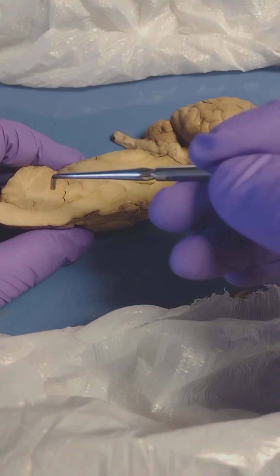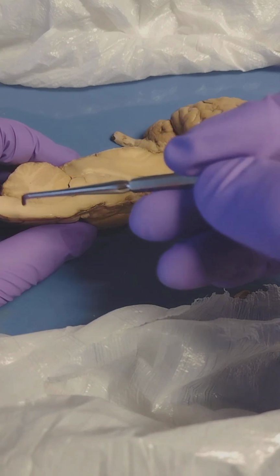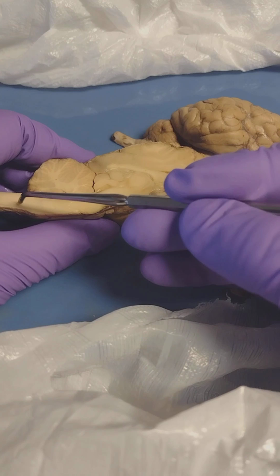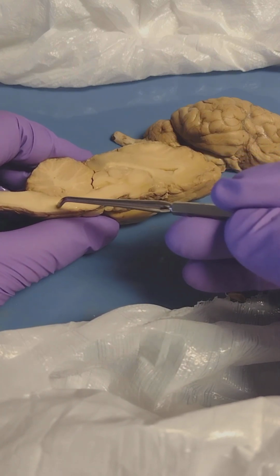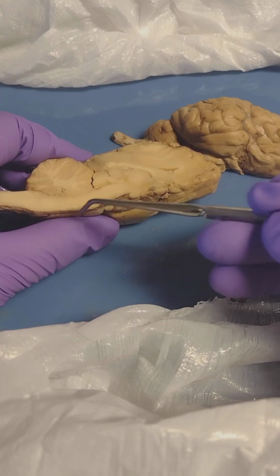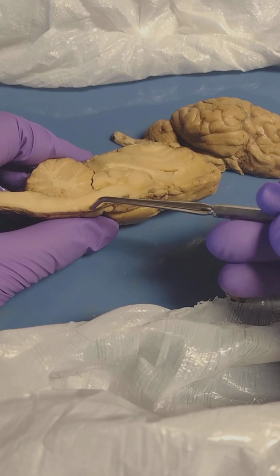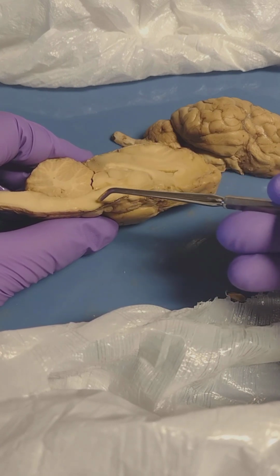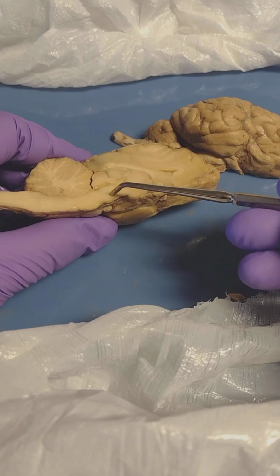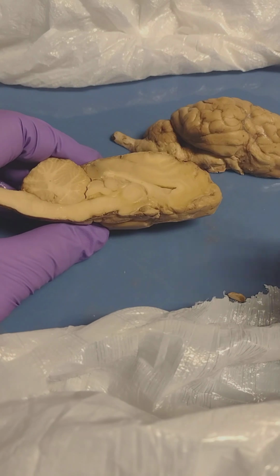So let's talk about the brainstem for a second. Like I mentioned earlier, this entire region will be the brainstem. Down here, of course, you have the spinal cord. As you move up, you have the medulla. The medulla helps regulate heart rate, blood pressure, and breathing. And this little bump right here, that is the pons. It transmits sensory and motor signals, and it helps in REM sleep and plays a role in regulating breathing. Up here we have the midbrain, which coordinates vision, hearing, and motor control.